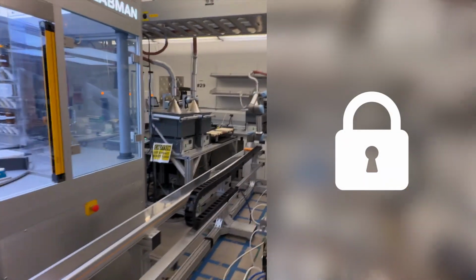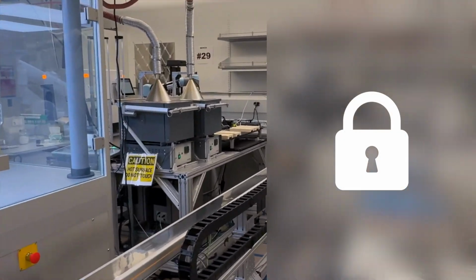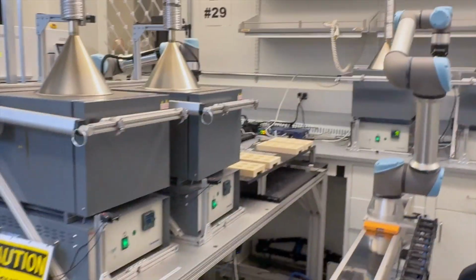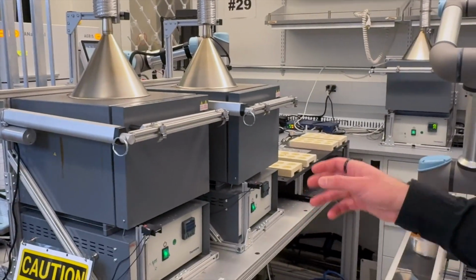Well, you mentioned the furnace doors. I want to again check out your masterpiece here that you were developing. The very initial one. Yeah, we can come closer here. Okay. The robot's paused, so it's safe to come. Okay. Cool. So yeah, it's very basic.